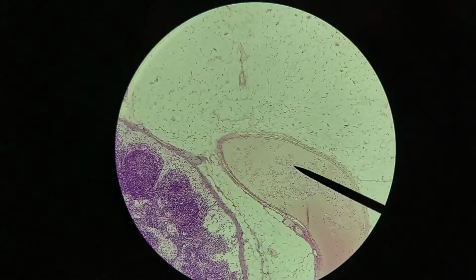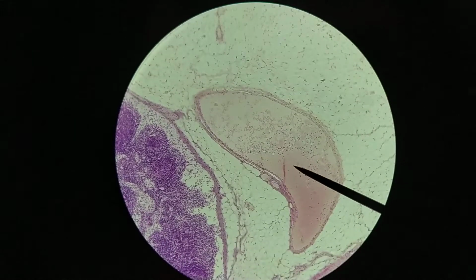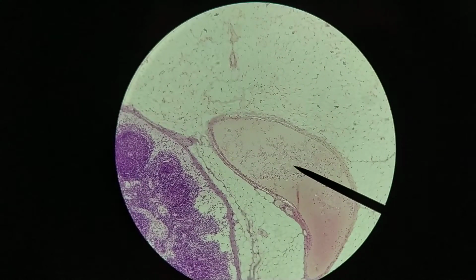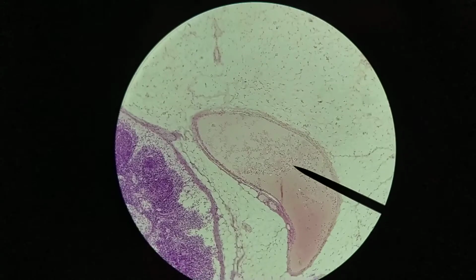In fact, what you're seeing here is likely to be the efferent lymphatic vessel, potentially. Looks like it's a lot of massive eosinophilic material in here, so that's likely to be lymph. And the nuclei in here are likely to be the lymphocytes that will be carried away from the lymph node once they become activated and they are appropriately responding to whatever was brought into the lymph node.